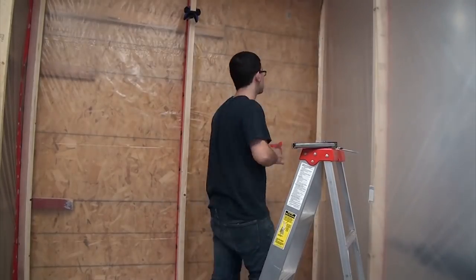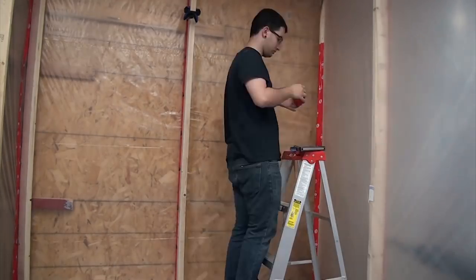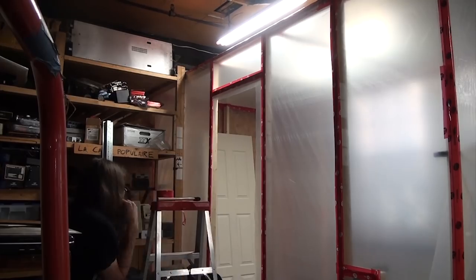Then we started on the inner layer of plastic, starting with the roof, but had to stop after only two walls were covered so that we could install the actual door. We built a frame out of some more wood, then stapled and taped the outside plastic to the frame before cutting a hole in the plastic for the door.